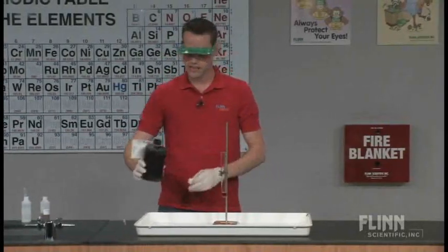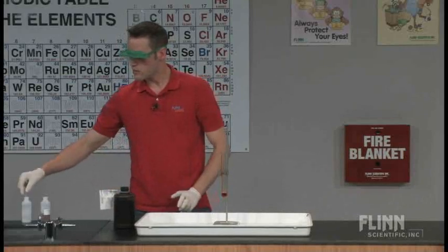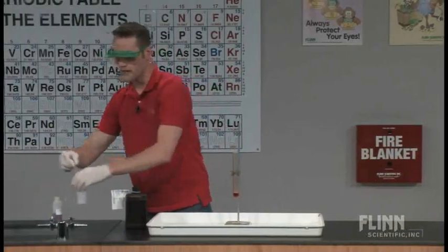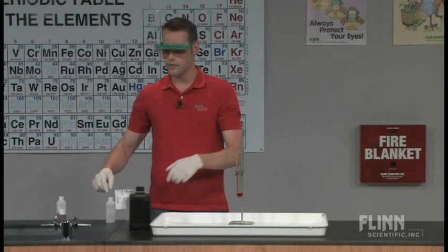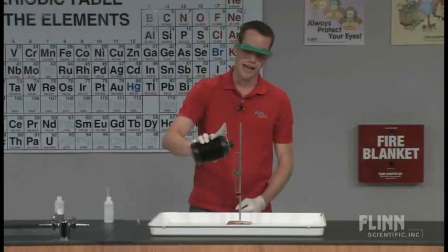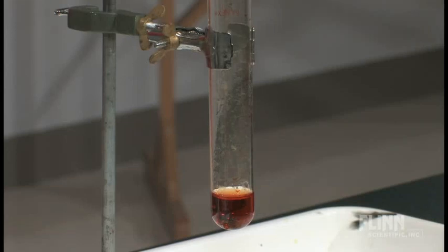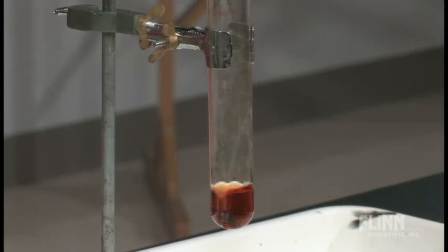I'm going to pour some of this in and I've got some sodium phosphate ready to go and I'll add the inhibitor once I get the bubbling going. I'll add the inhibitor so students can see the role of what happens when an inhibitor is added to a reaction. This one requires a little bit of dexterity so I'll add the peroxide in.